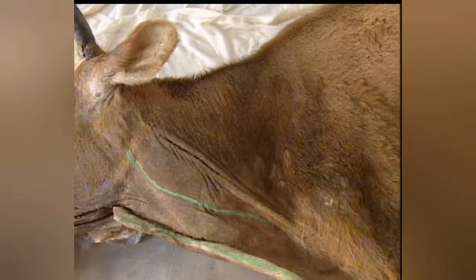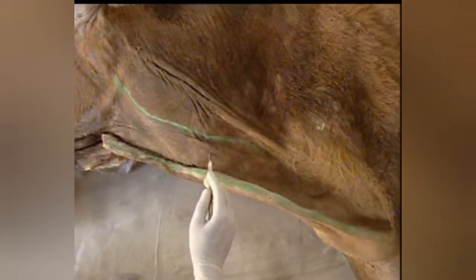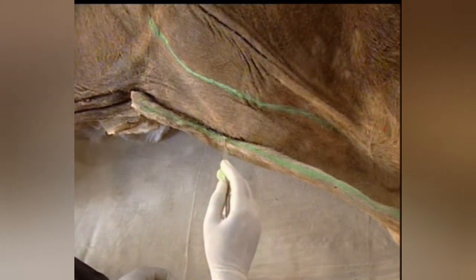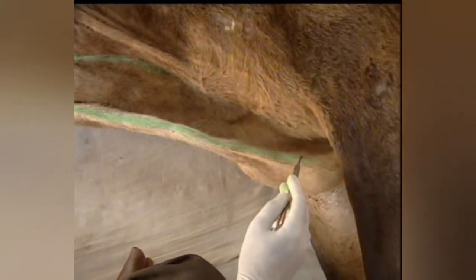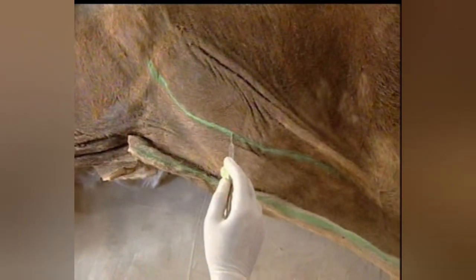Note the ventral aspect of the neck lying between the two parallel green lines drawn here. To expose the ventral aspect of the neck, make a longitudinal incision beginning from the corner angle of the mandible to the manubrium sternum. Make another parallel longitudinal incision at the jugular furrow. Then, reflect the skin flap upwards.